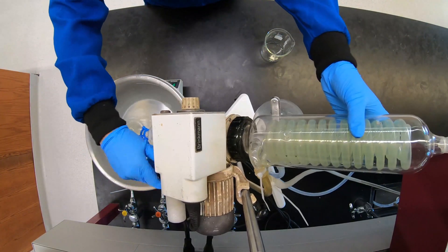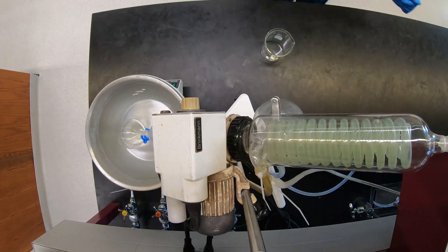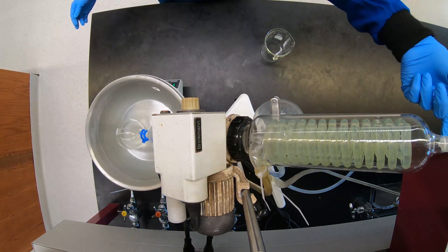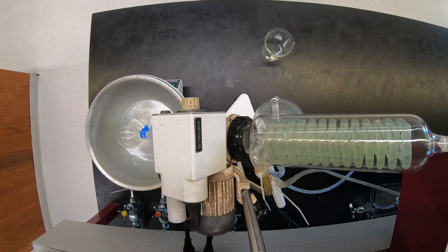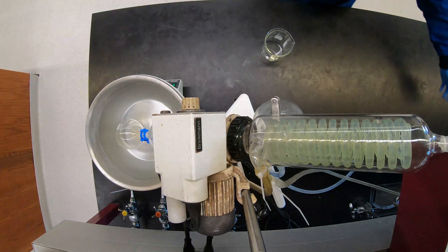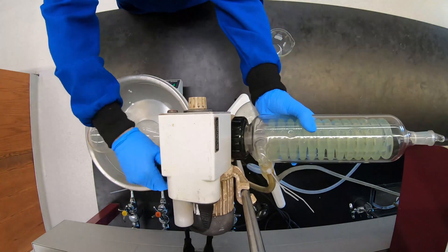Combine all your fractions of purified DEET into a 250 ml round bottom flask. Then you're going to evaporate off hexanes on the rotavap. Then weigh your purified DEET. Draw your TLC plate in your notebook. Be sure to report the RF values and labeled IR and NMR for your lab report.